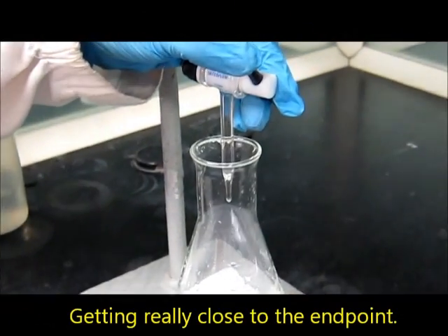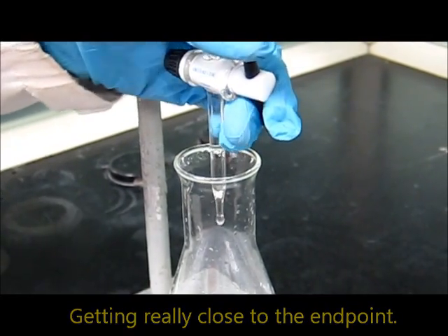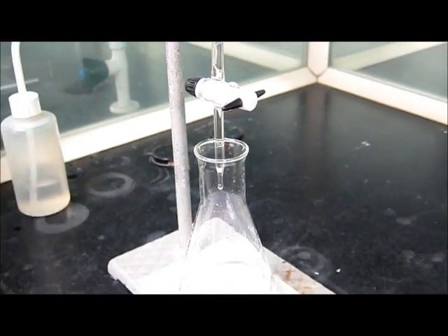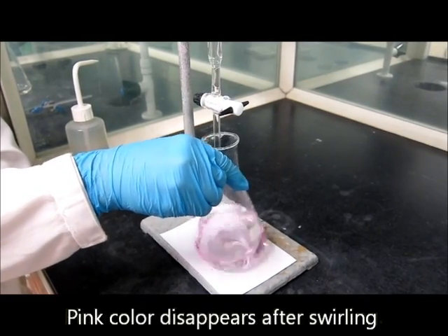Now, we are really getting close to the endpoint. And the pink colour will disappear after swirling.